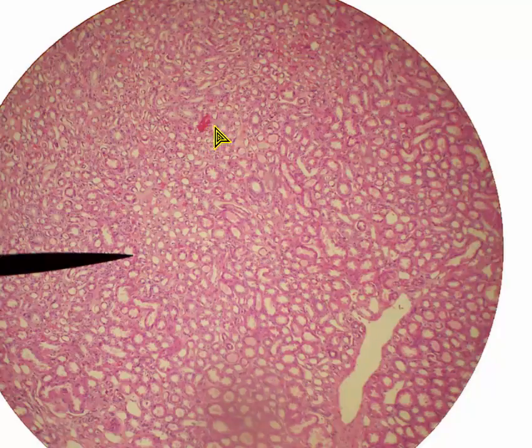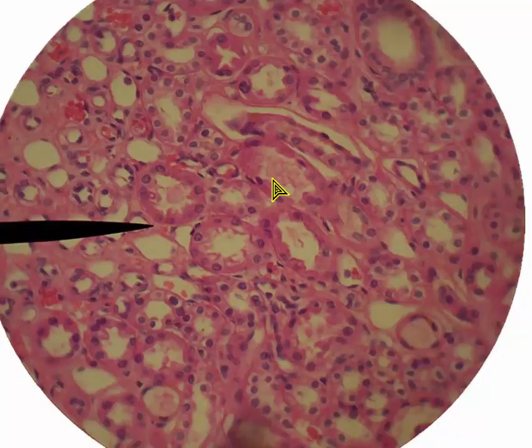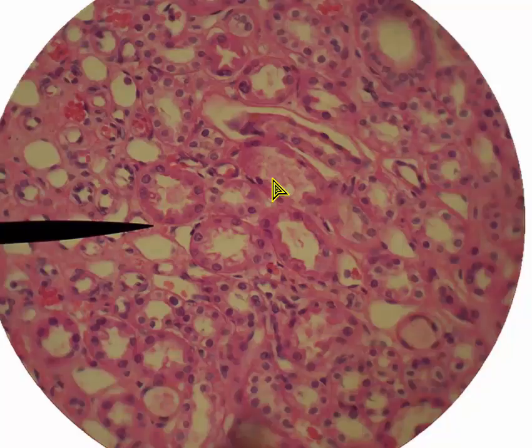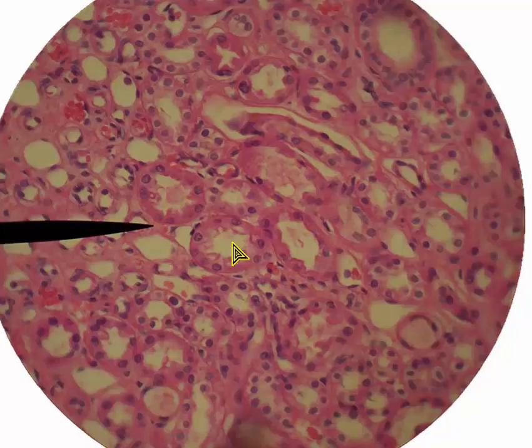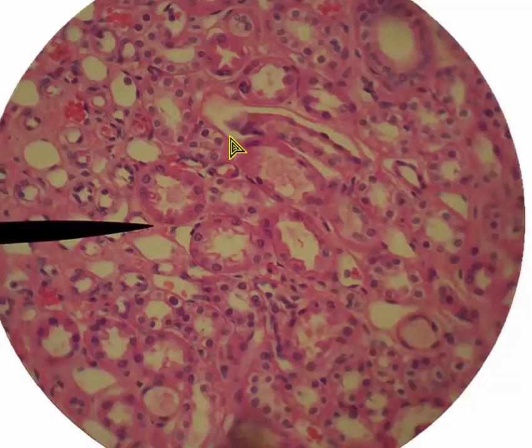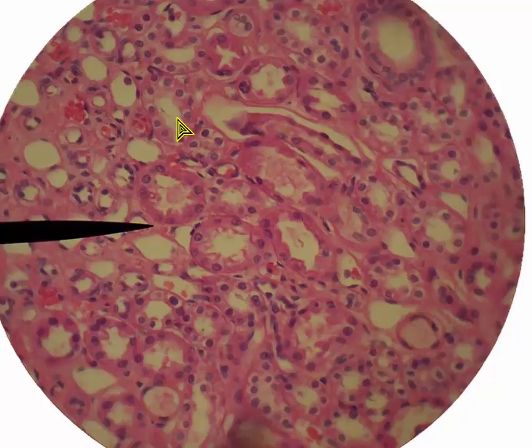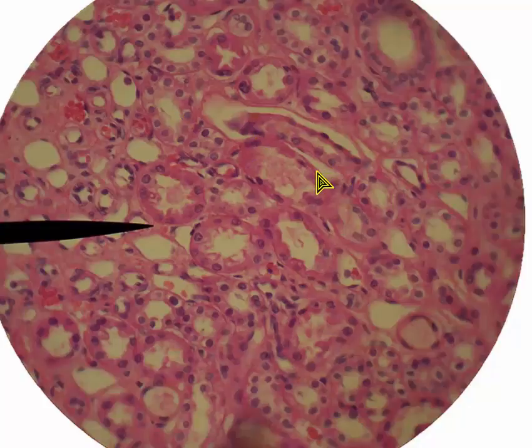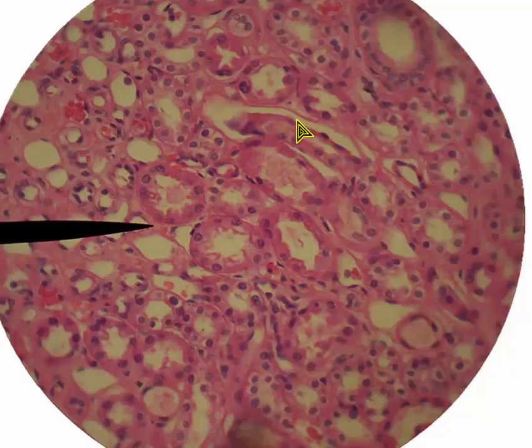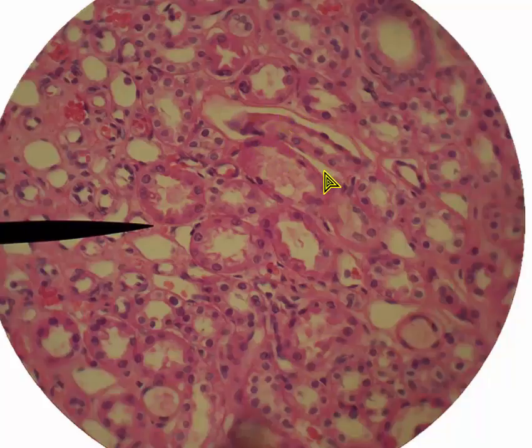Here appears to be a larger blood vessel. At 450 times magnification of the medullary region of the kidney — so we're down in one of the pyramids — we've got renal tubules. These are down in the nephron loop or loop of Henle. Nicely here, one of them looks like it's coming in and then making a U-turn, which is what happens at the bottom of the nephron loop. So this might be the bottom of a nephron loop.